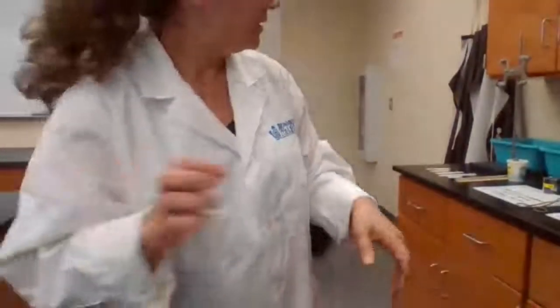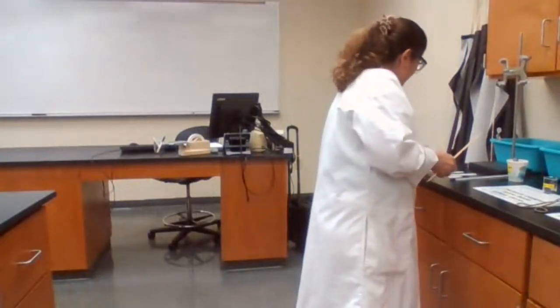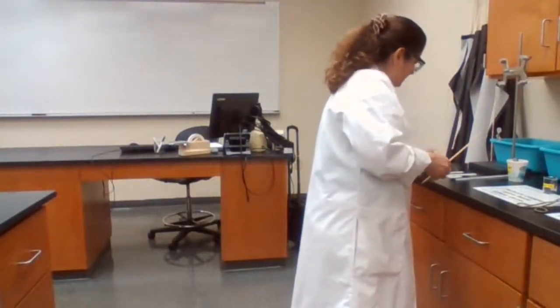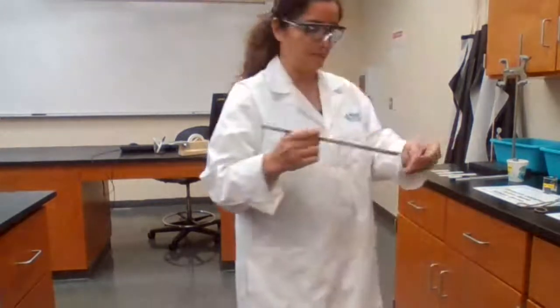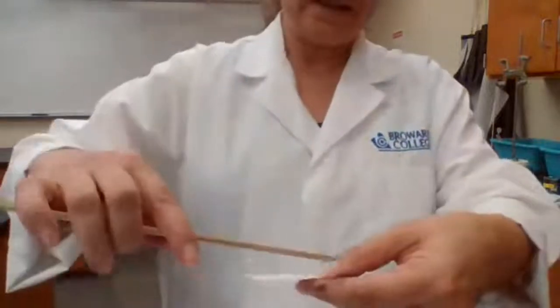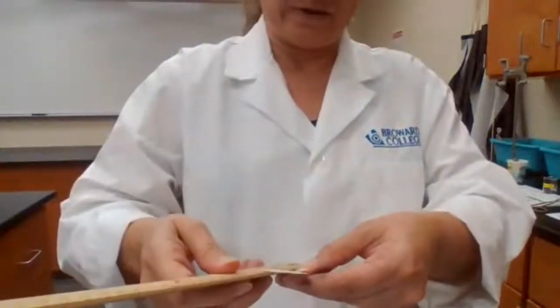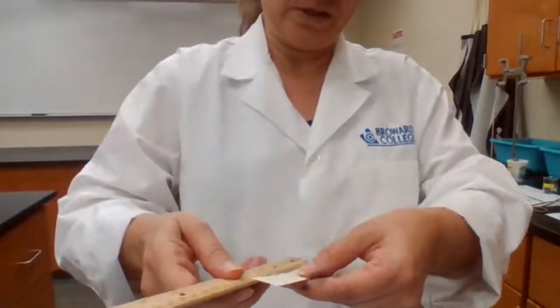For 10, using a ruler. There are like 5 pieces of paper here. I took piece number 1, and in order to measure the length, I'm using the centimeter because this ruler has centimeter, and we are given the choice of centimeter or inches.